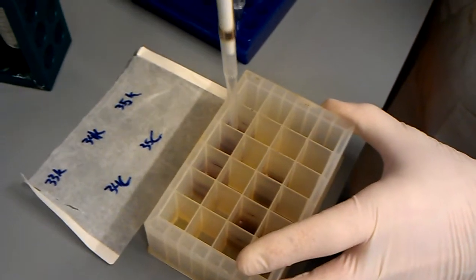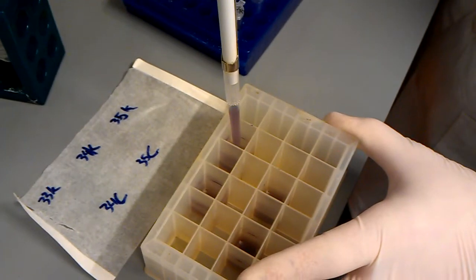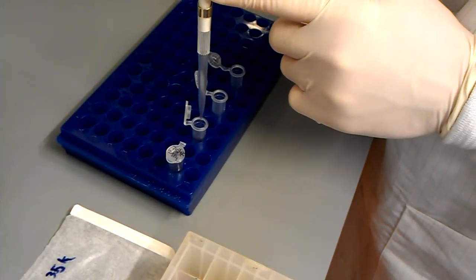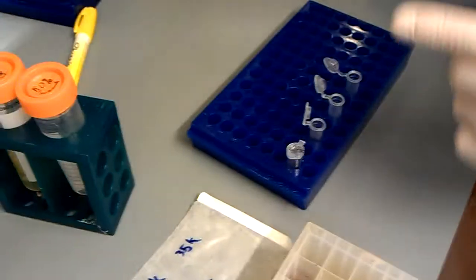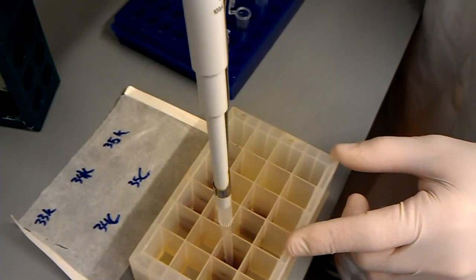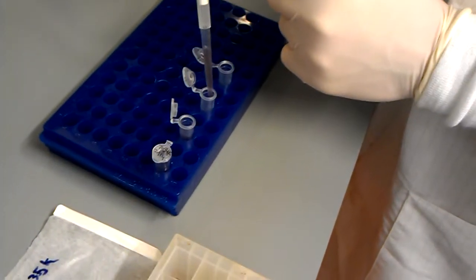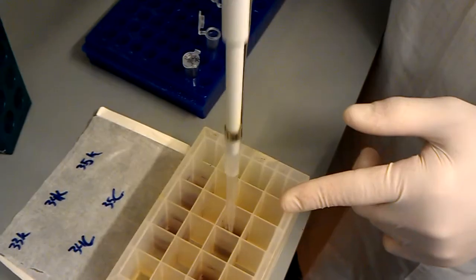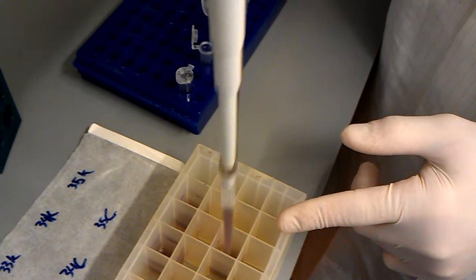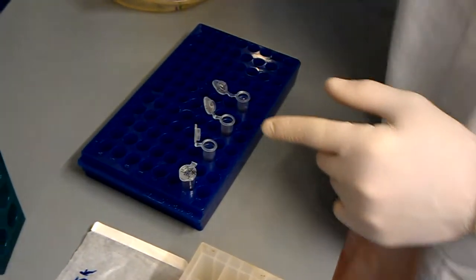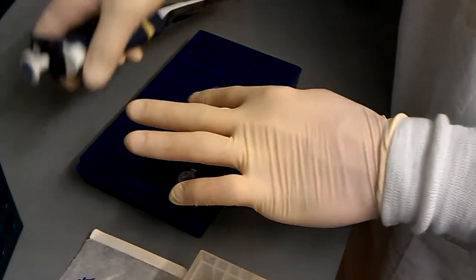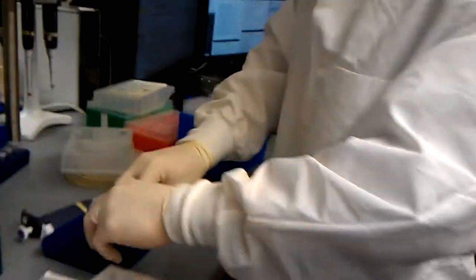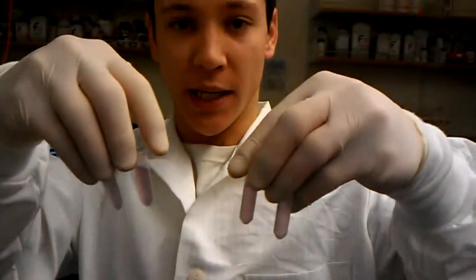So we want 7035K, which is right here. Now I switch tips because I'm going to go into a different culture. So, 7034C. Switch tips one last time. 7035C. Now we just cap. Give it a good shake. And these are ready to go into the minus 80.